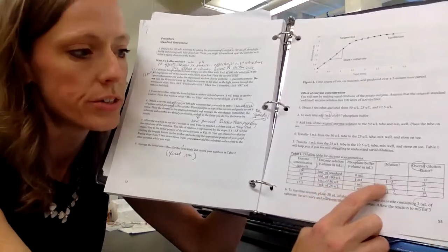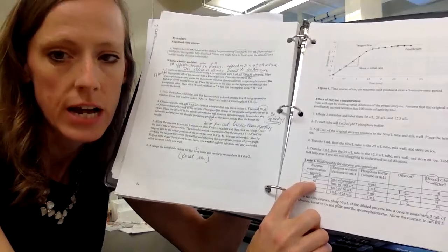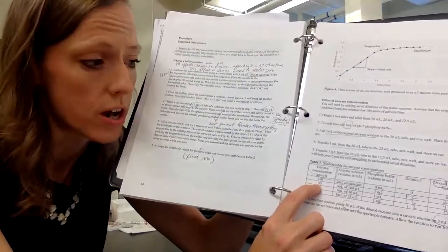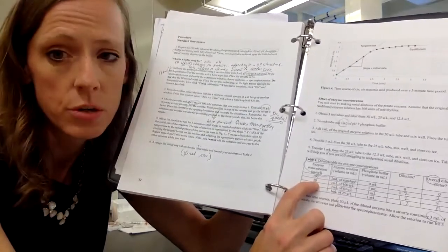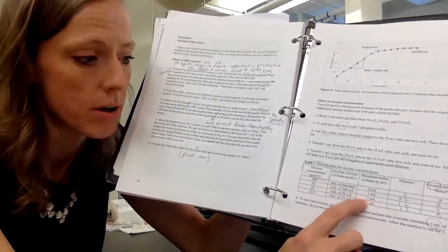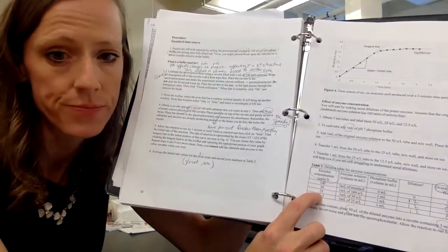And so that's a 1-to-2 dilution, and then we call that one 50 units per liter. And then we basically just do a serial dilution of the enzymes, okay? So we do the exact same thing. We take 1 milliliter of the 50 units per liter and mix it with 1 milliliter of phosphate buffer in order to get the 25 unit per liter enzyme concentration, okay?